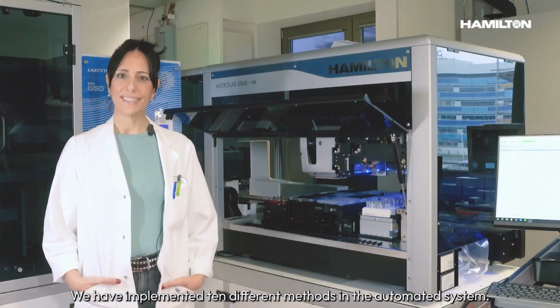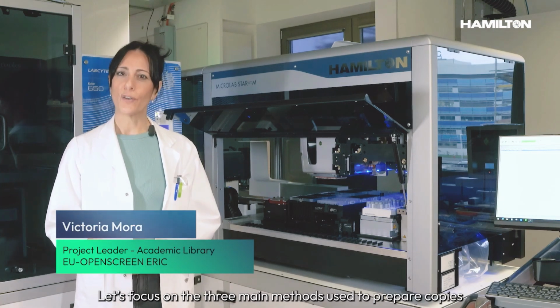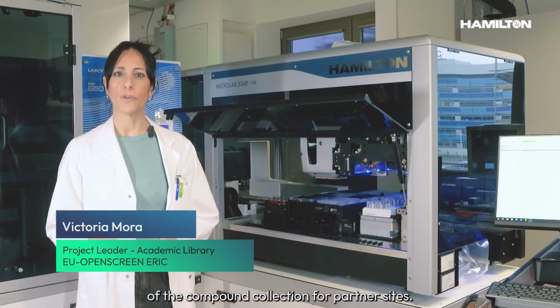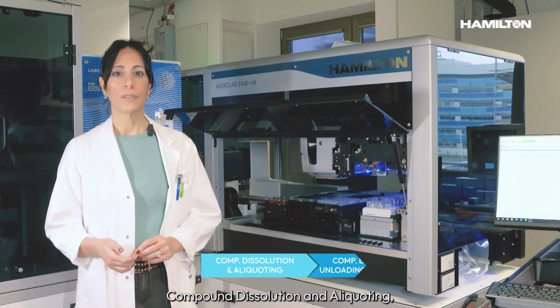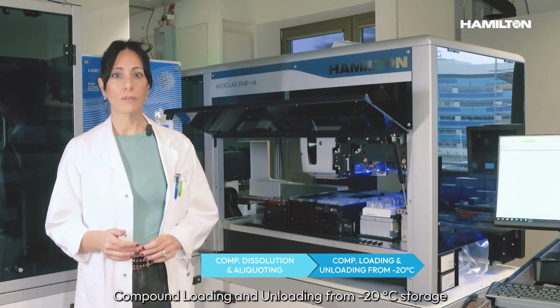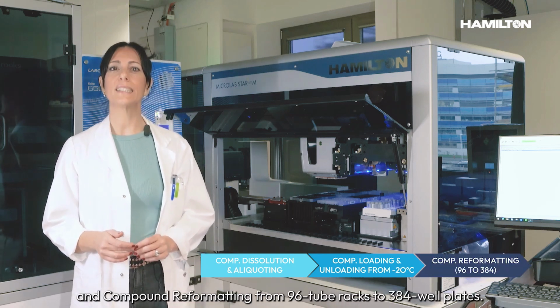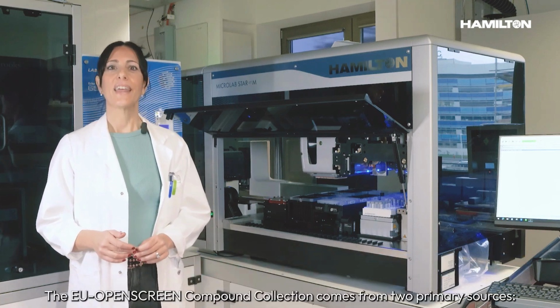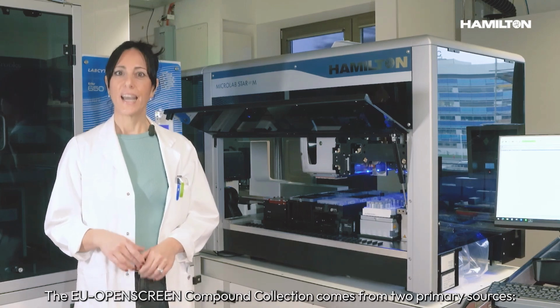We have implemented 10 different methods in the automated system. Let's focus on the 3 main methods used to prepare copies of the compounds collection for partner sites: compounds dissolution and aliquoting, compounds loading and unloading from minus 20 degrees storage, and compounds reformatting from 96 tube racks to 384 well plates. The EU Open Screen compounds collection comes from 2 main resources: academic research groups and commercial vendors.